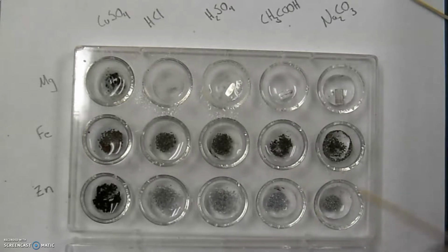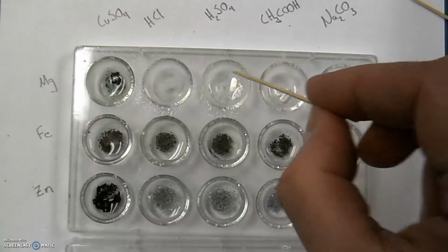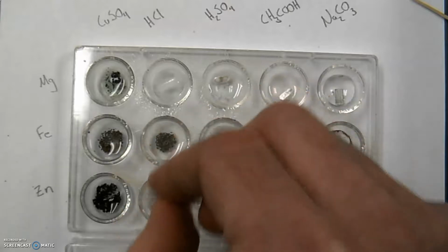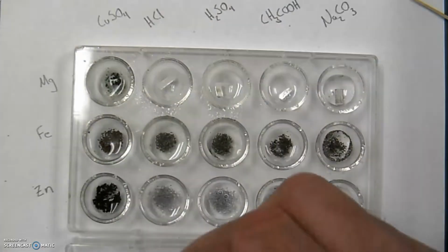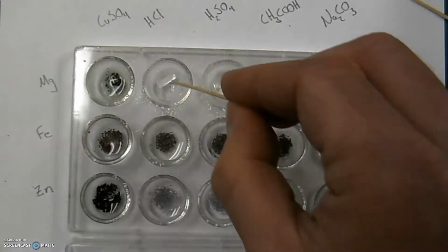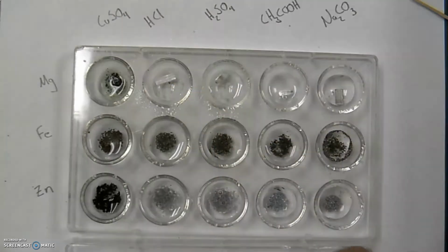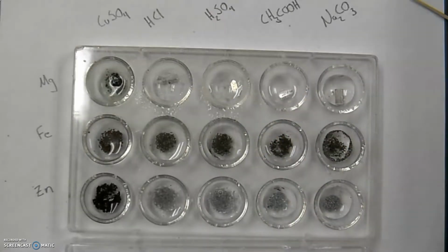And so we can see again with these bubbles, that is an indication of a chemical reaction taking place. These color changes, the switch you're seeing, that was a blue solution put in here, and for the most part you don't see that blue solution. Bubbles aren't all the same. So the bubbles you're seeing forming up here may be different than the bubbles you're seeing down in these spot plates. So we have to decide what is a reaction and what is not a reaction.